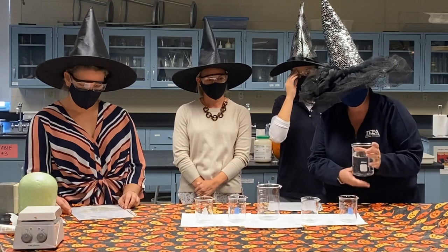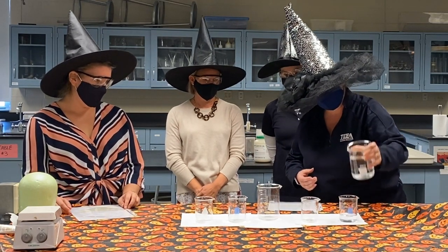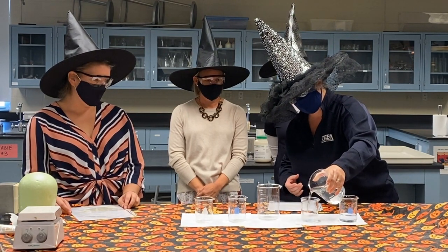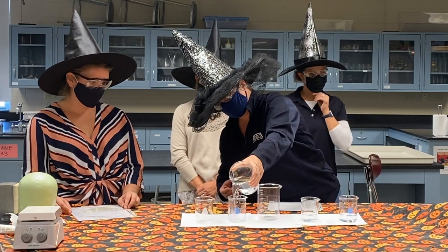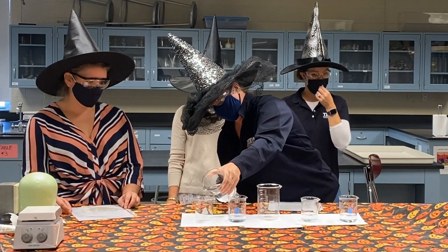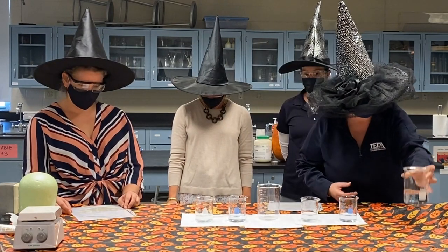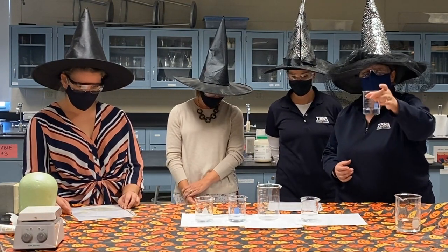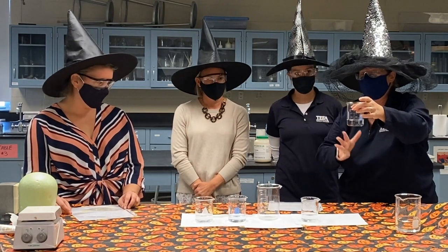Four witches made quite a commotion when I invited them to create a potion. Into 4 glasses went the magic brew. And into a rage the first witch flew. There's no magic in this drink. To cast a spell, it must be pink.